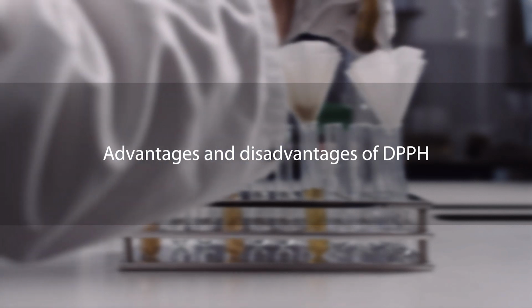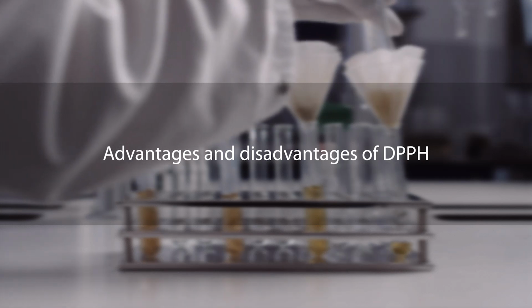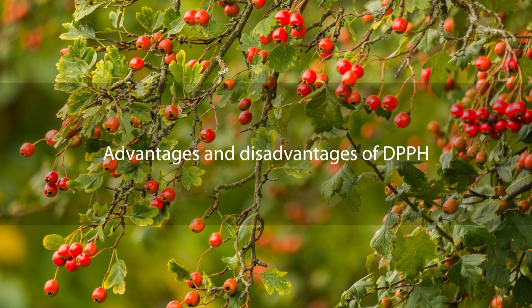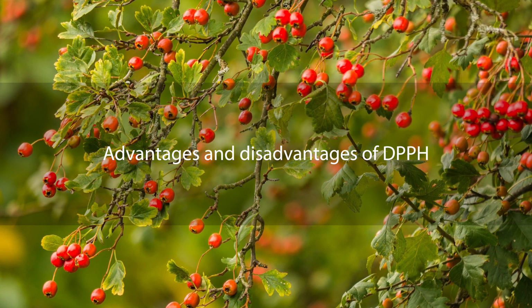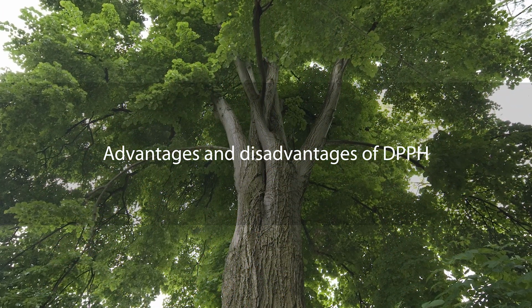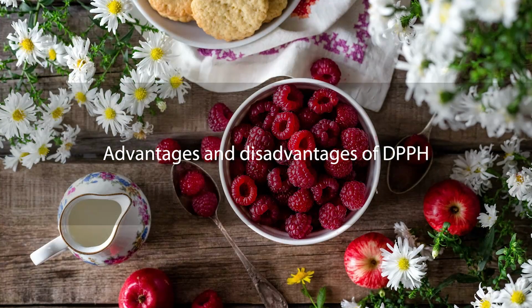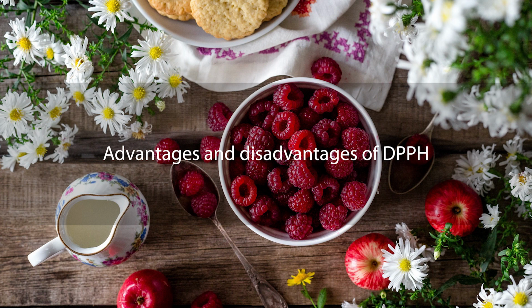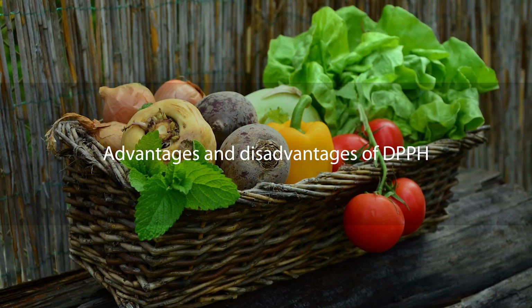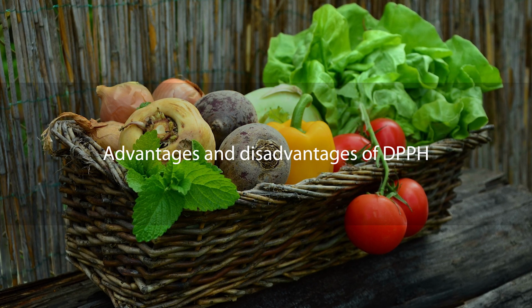It is suitable for determining the antioxidant activity of pure compounds, extracts or biological samples in vitro. It can also be used for thermolabile compounds. The disadvantage of the method is that DPPH is an exogenous radical that dissolves only in organic media, so the antioxidant activity identified does not reflect the potential of antioxidants in the biological system. To overcome the above limitations and obtain more biologically relevant results, we perform several different tests to capture as many antioxidants as possible in the samples and their different mechanisms of action.